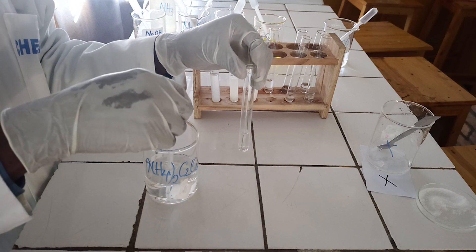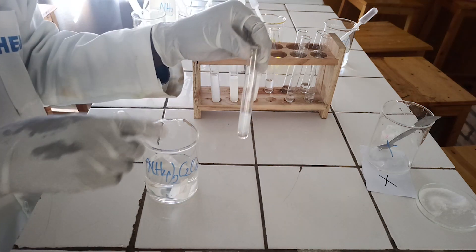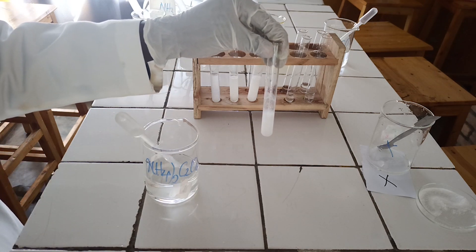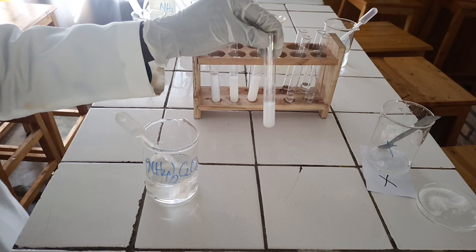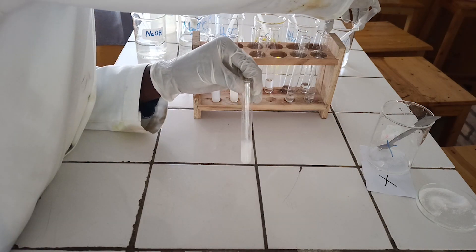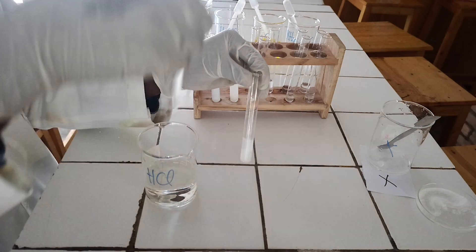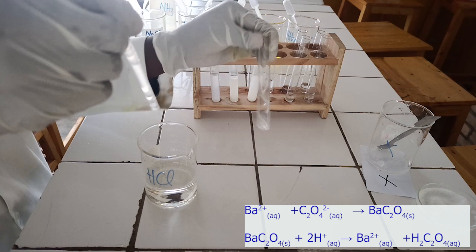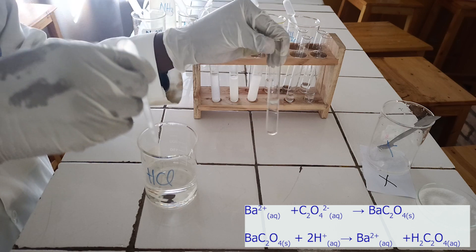To the fourth test tube, add a few drops of ammonium oxalate solution followed by diluted hydrochloric acid. As you see, ammonium oxalate reacts with barium ion to form a white precipitate, which is soluble in hydrochloric acid solution. Below, there is the ionic equation for this reaction.